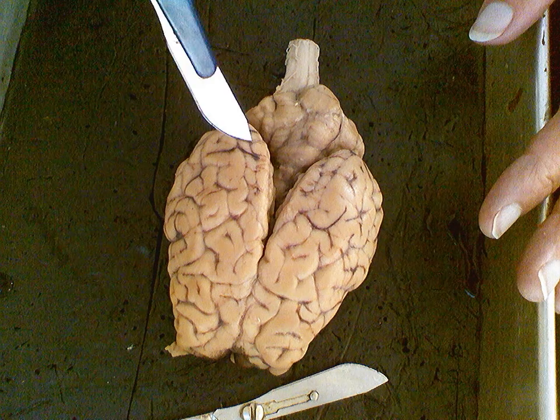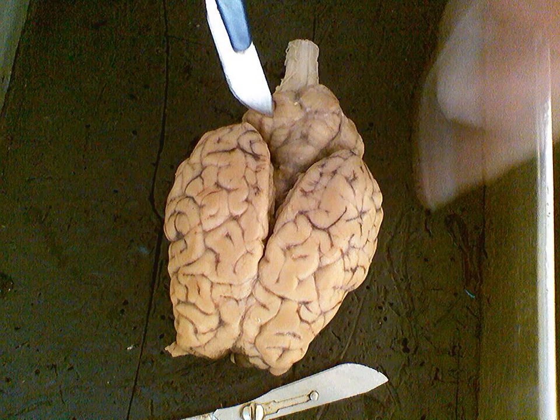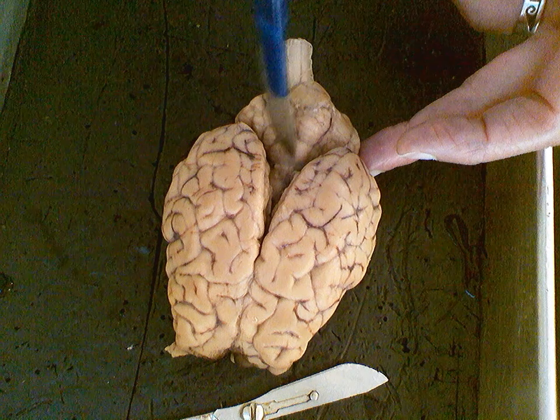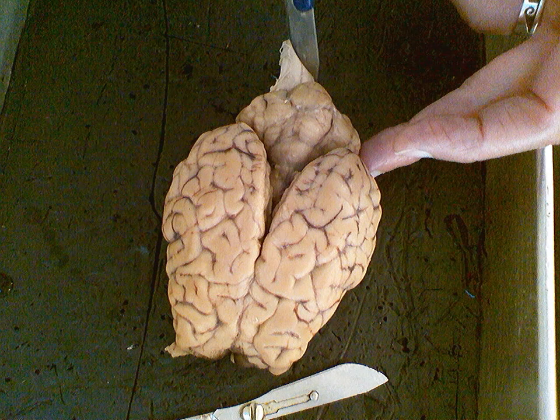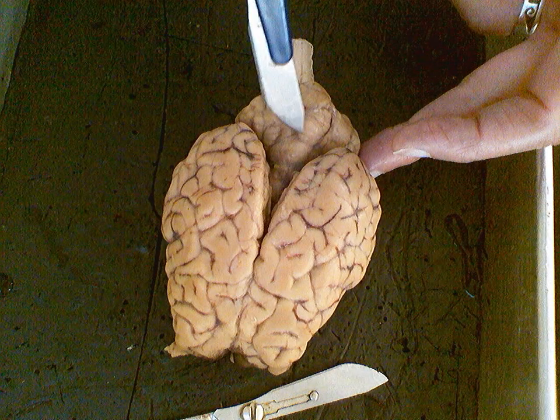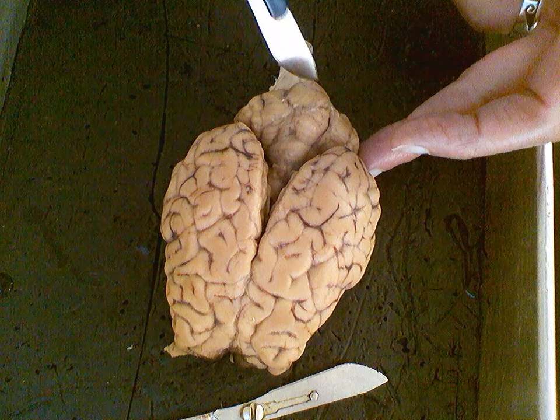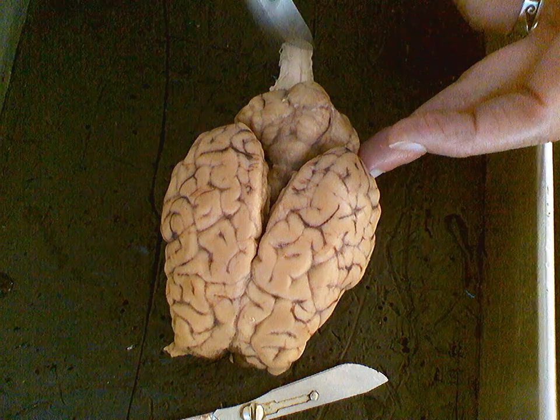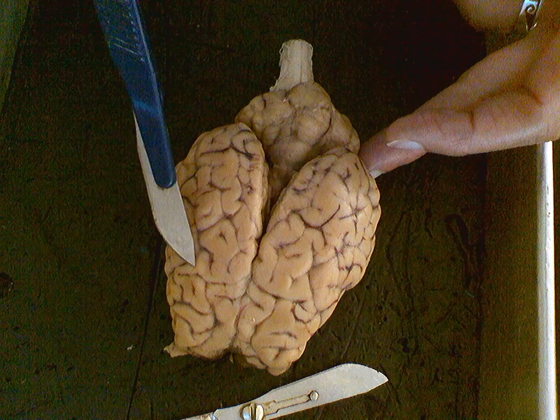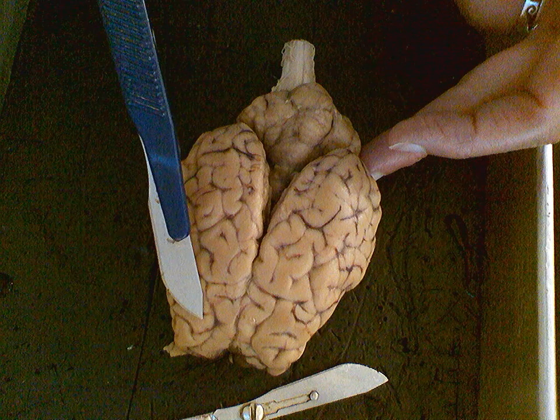We also have this large region back here of the brain we know as the cerebellum, which also has a right and a left hemisphere, and a large kind of segmented structure that goes down the middle called the vermis. These segments actually make it look like a worm, and the word vermis is referring to worm-like. As we continue further caudally, we see extending outward from this side the spinal cord. Both of these are called cerebral hemispheres. Collectively, we could call this the cerebrum.